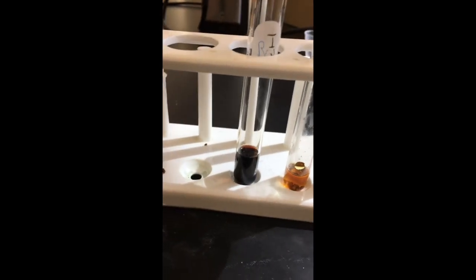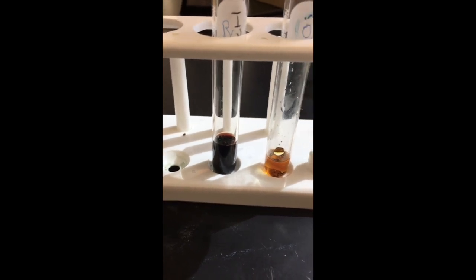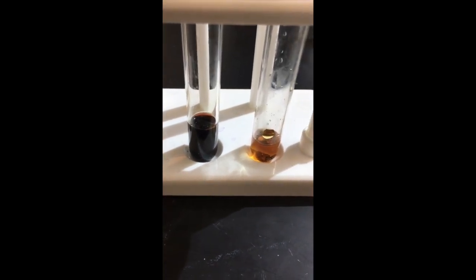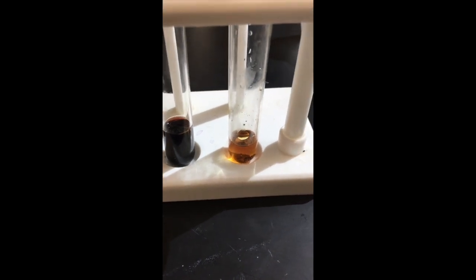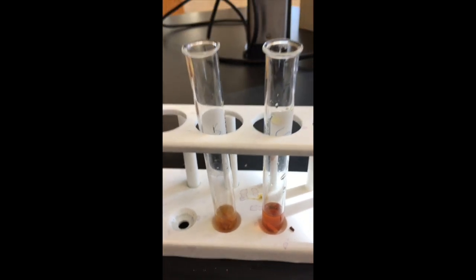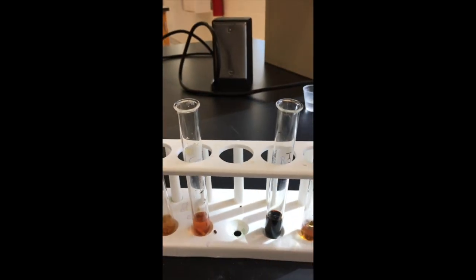In the bread there are starches, complex carbohydrates, so you get this deep blue, this deep violet color here, this almost black color, showing that complex carbohydrates are there, versus the others that are not that same color, indicating a negative presence of complex carbohydrates or polysaccharides.